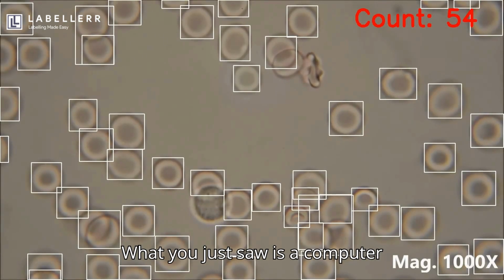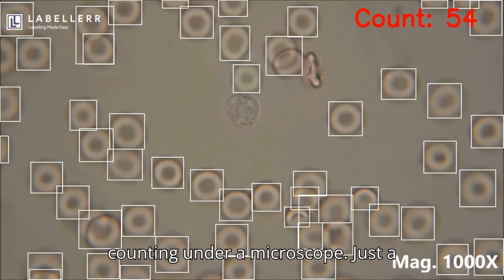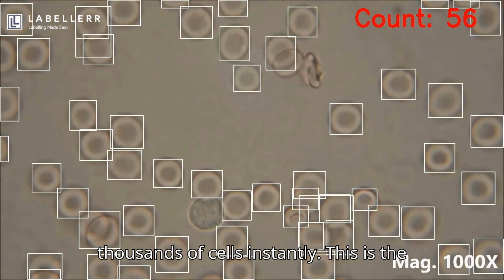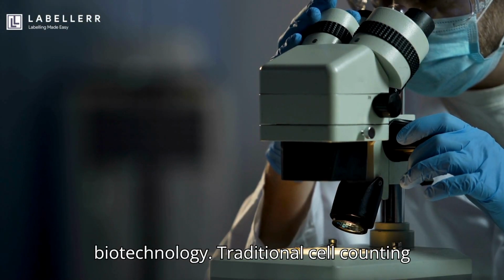What you just saw is a computer vision-based system that counts cells in real time, without the need for manual counting under a microscope. Just a camera and AI models that can analyze thousands of cells instantly. This is the power of computer vision in biotechnology.